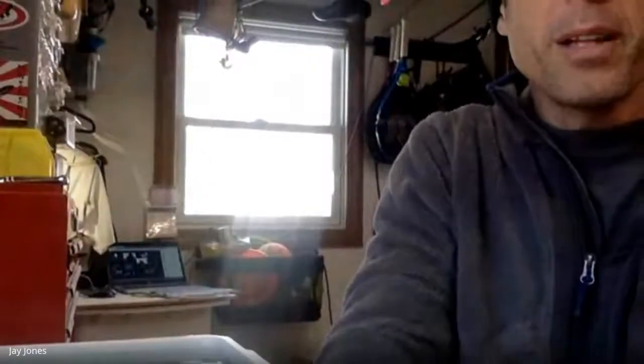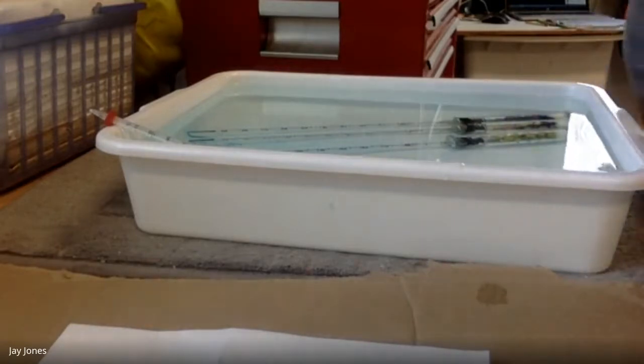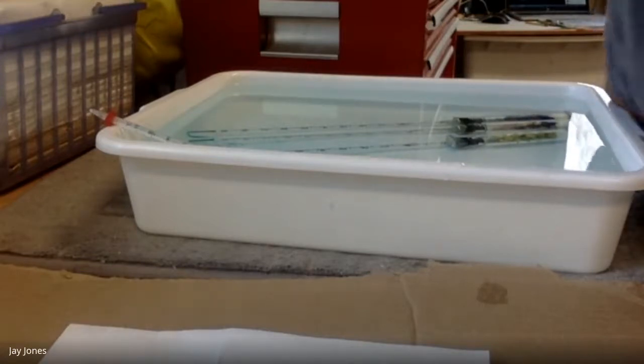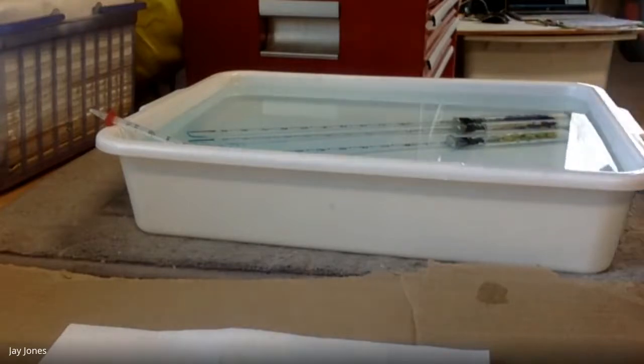49. All right, we're at 3 minutes. Next reading, here we go. Next reading, 0.79 for germ, Shreya, 0.79, 0.83 for dry, 0.93 for dry, and 0.92 for beads only. Okay. Thank you. All right, 49, 50, 51, 52, 52-ish, towards 53 actually. I'm a little late.